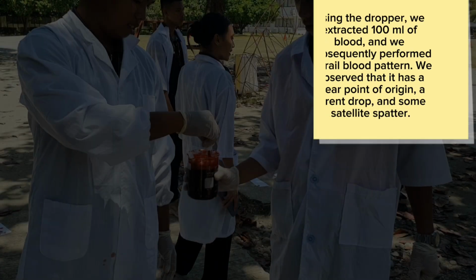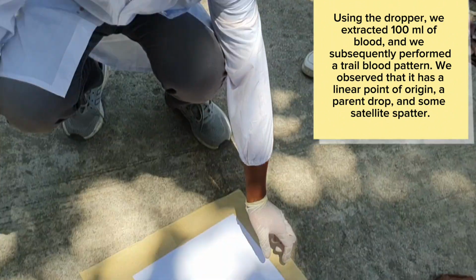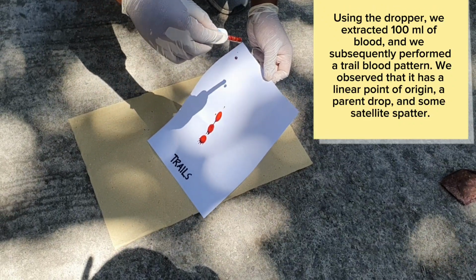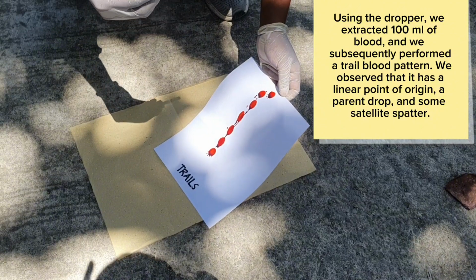Trail. Using the dropper, we extracted 100 ml of blood, and we subsequently performed a trail blood pattern. We observed that it has a linear point of origin, a parent drop, and some satellite spatter.